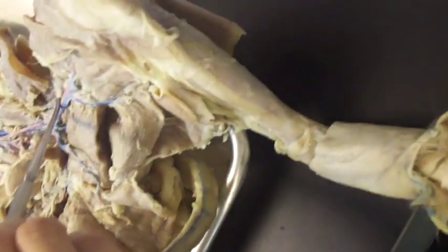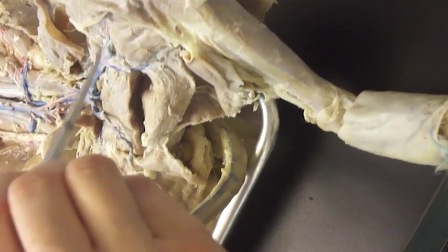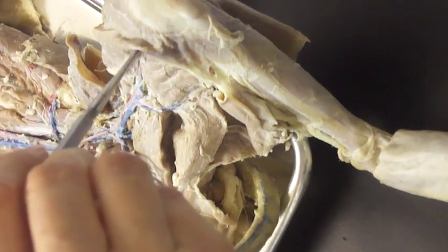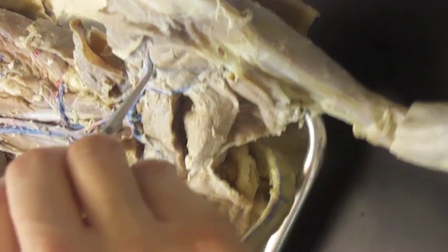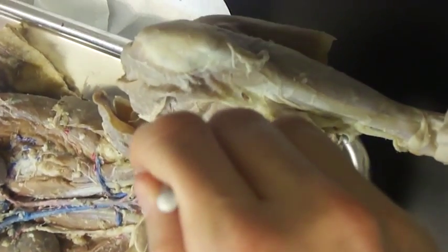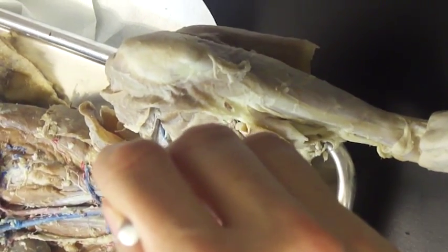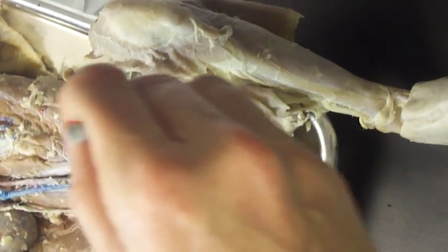As the femoral continues down, there's another split, and the branch that goes towards the knee is popliteal — both artery and vein. What you are missing on this cat is the saphenous; particularly the vein is what you have to know — the great saphenous, it goes all the way down to the foot.